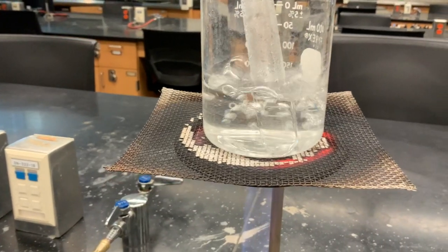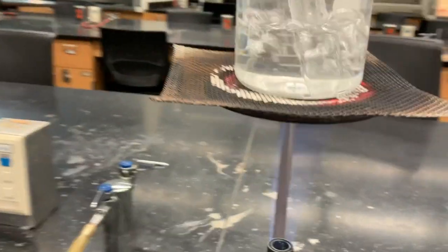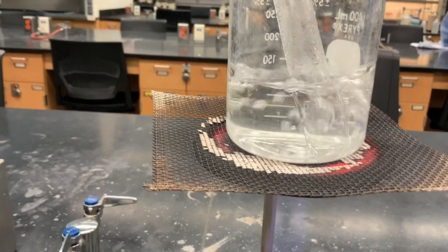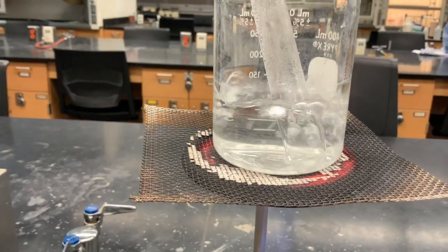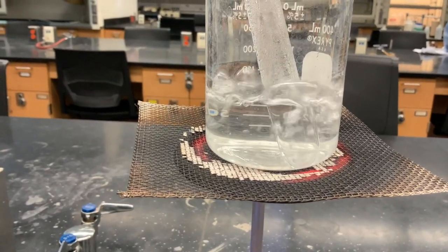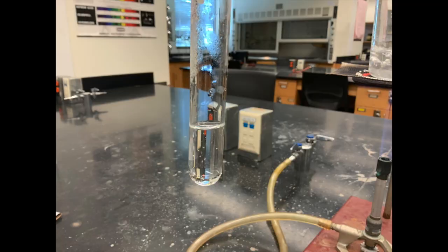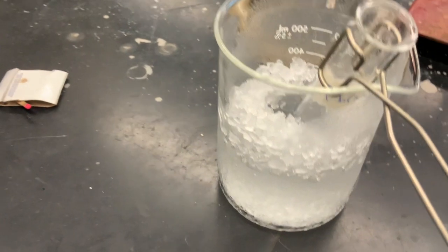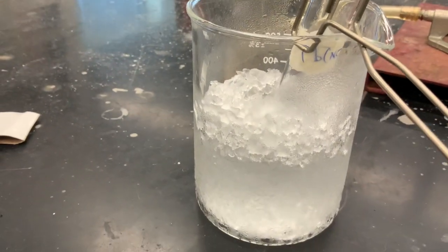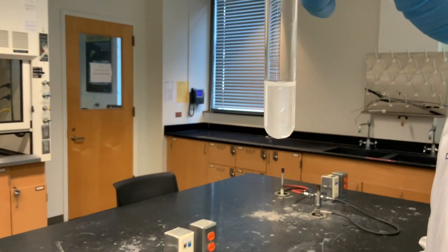We then set up a hot water bath by heating water in a beaker over a Bunsen burner. While the test tube is being heated, we gently mix the solution inside using a stirring rod. Record the change you observe. We then put the solution in an ice water bath and let it cool down. Again, record the change you observe.